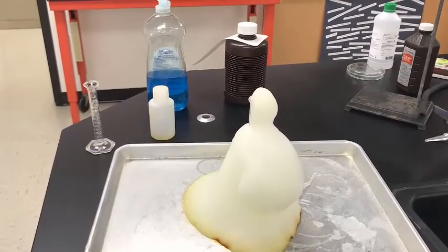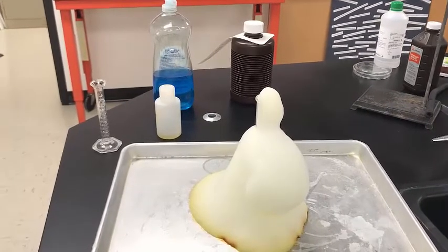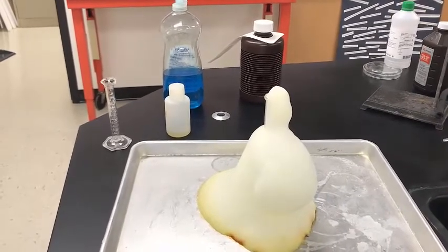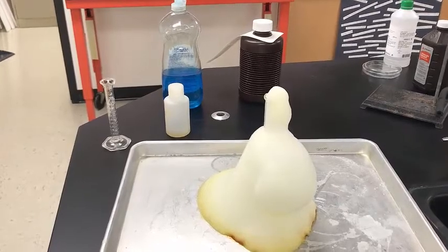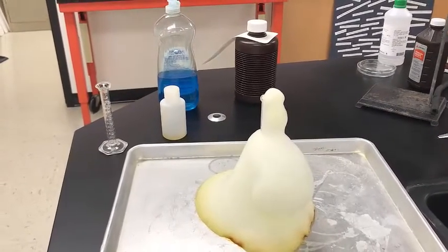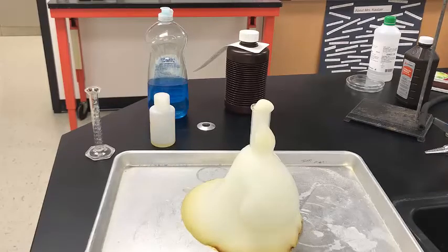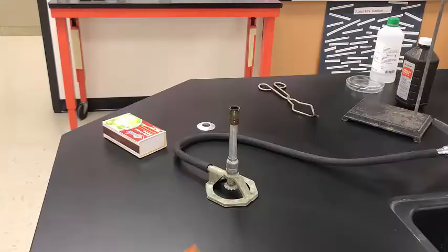Also think about what you'd have as a product, or what you'd have if you were going to make soap bubbles like that at home. What other substance would you use? You would use soap solution and a whole bunch of water, of course. So the other product of this reaction is water. Lastly, since this reaction gave off a whole bunch of heat, heat was exiting our system, right? So we would call this an exothermic type of reaction. All right, so to finish this up, you're going to write your balanced equation. On to our next reaction.